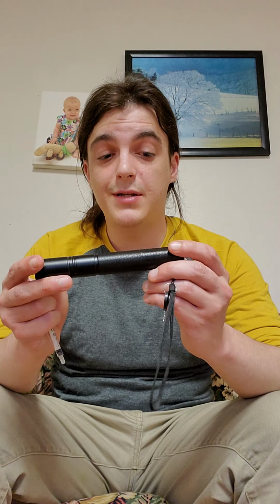The things we actually need: you're going to need a laser. Now, this is going to be a part that can be kind of dangerous, so if you do have the materials around, you want your parents to help you with this experiment. Probably have them hold the laser so nobody gets shined in the eye. These can hurt your eyes very badly, especially if you can tell this is big compared to the average laser you've seen. This is a very high-powered one because I find that a bright laser works really well, and particularly a green laser works really well.